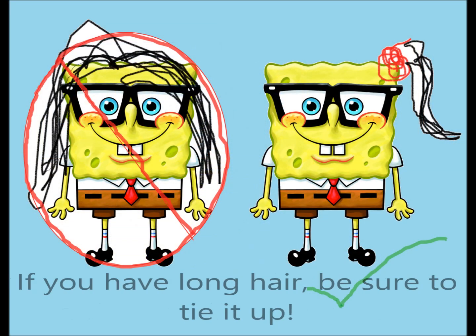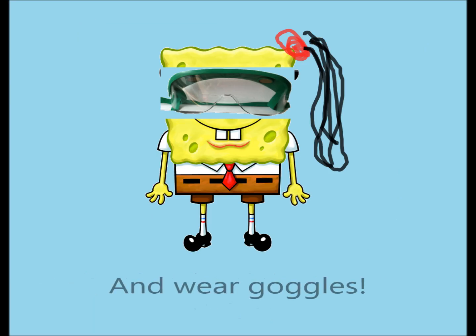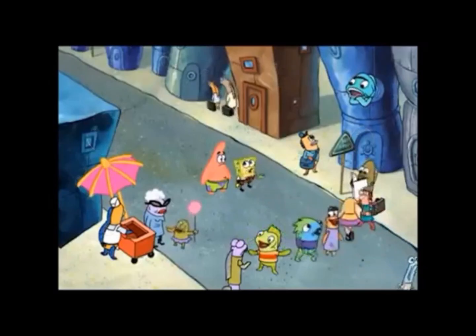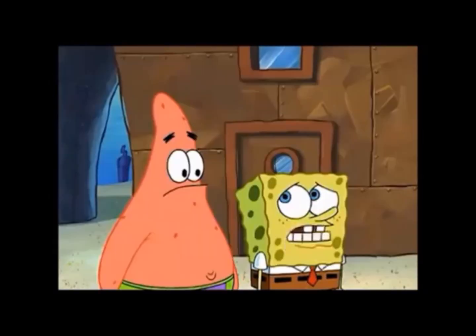Before we start, make sure to tie back long hair and to wear goggles at all times. Okay, Patrick, this is a very delicate situation and must be treated with great care and sensitivity. Gotcha!